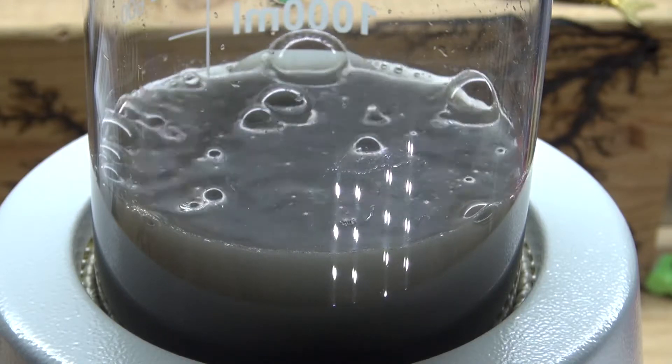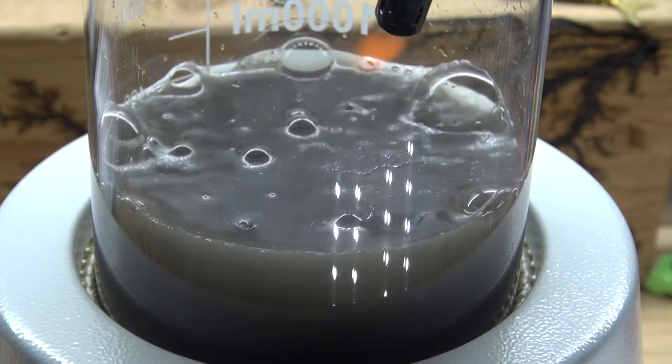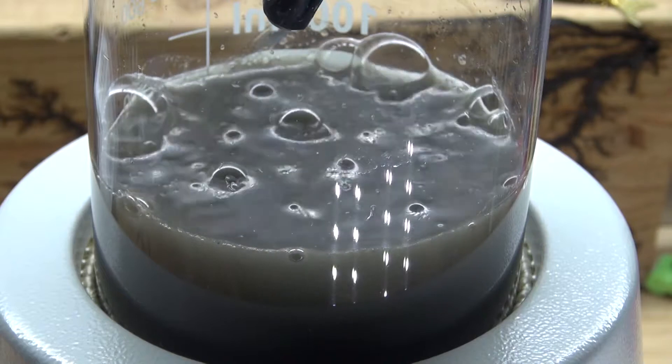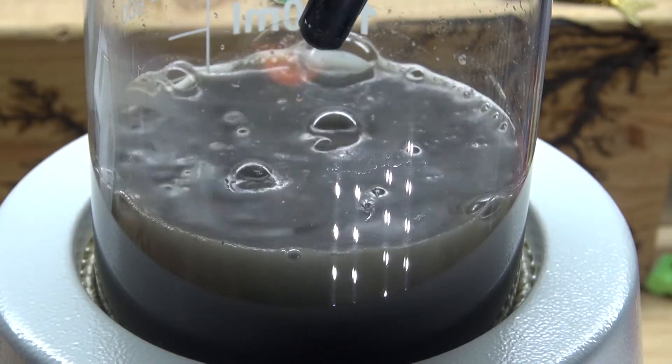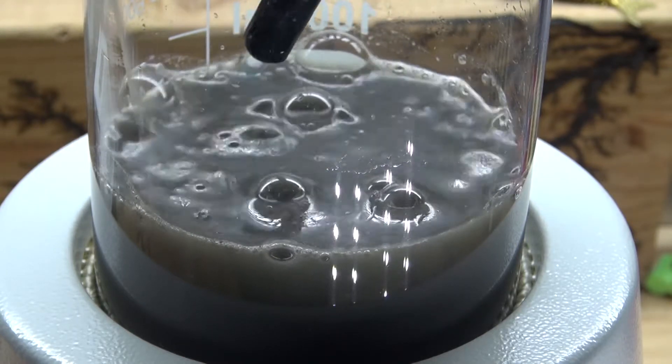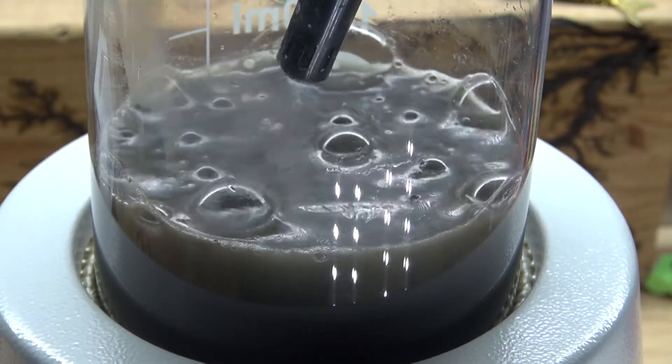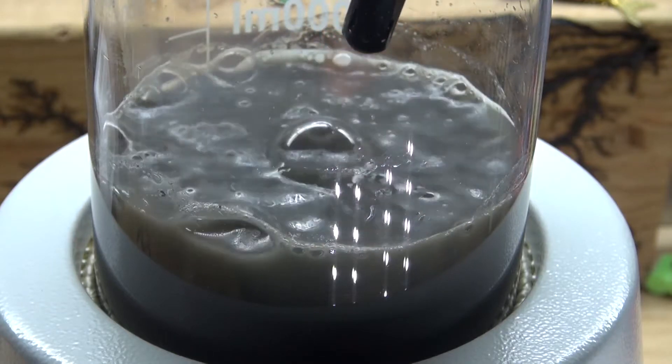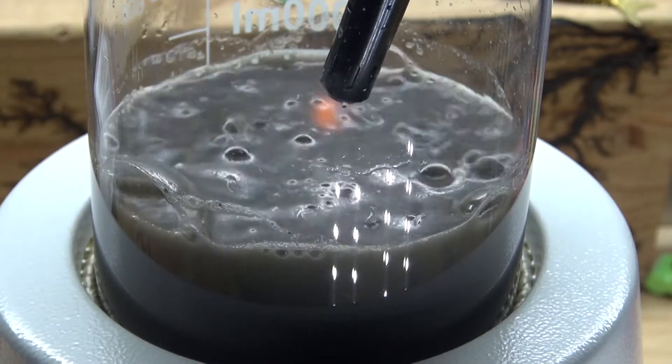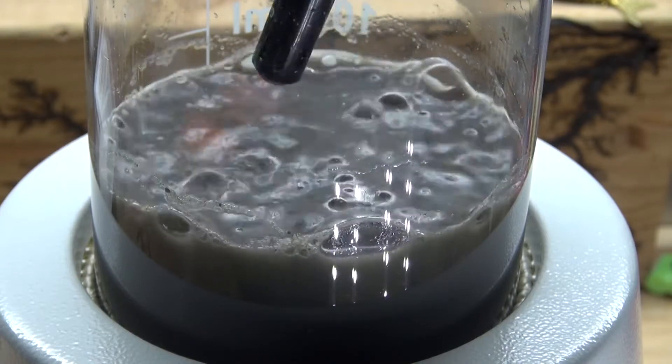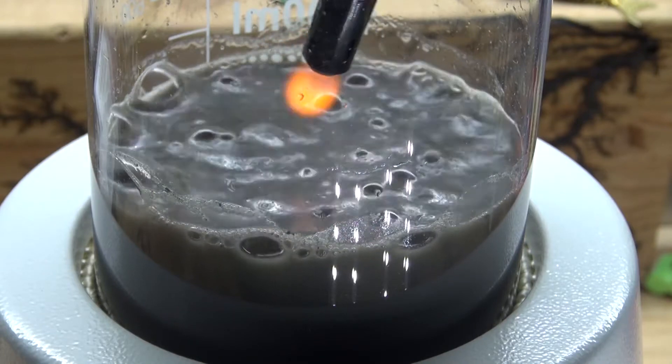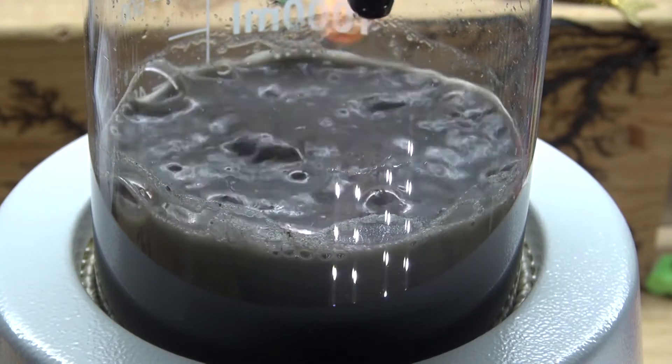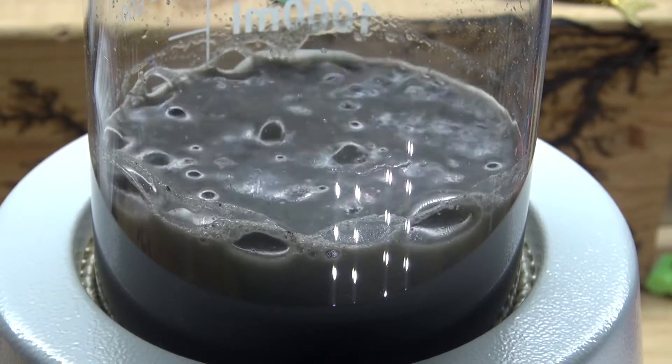Now I'm going to go ahead and light the hydrogen gas. As you can see, the bubbles are popping. Little fireballs. You can tell that's hydrogen gas.